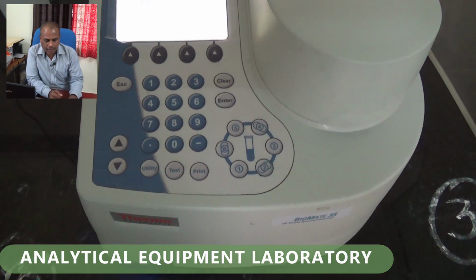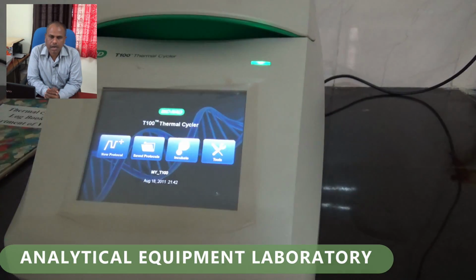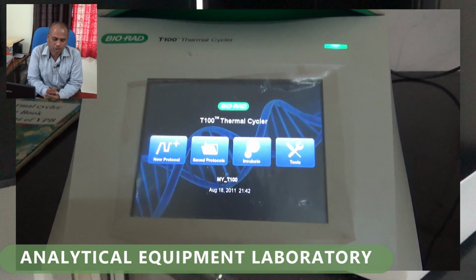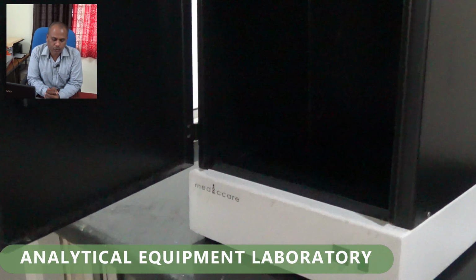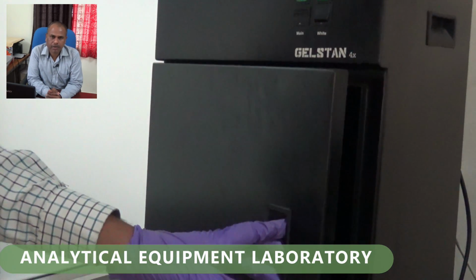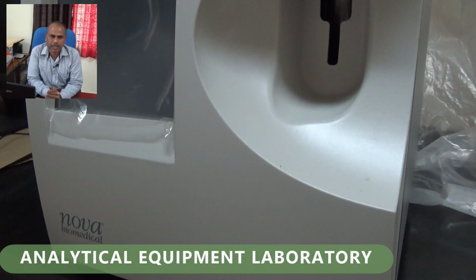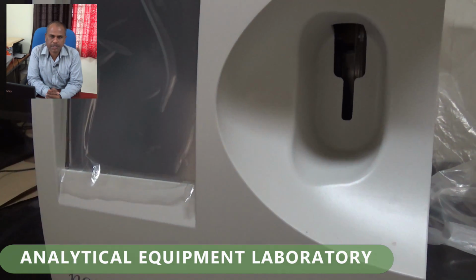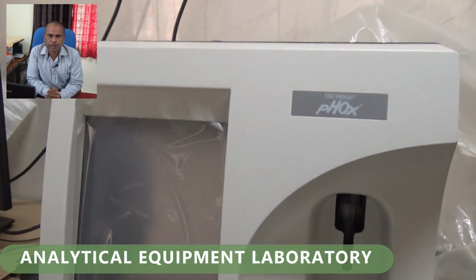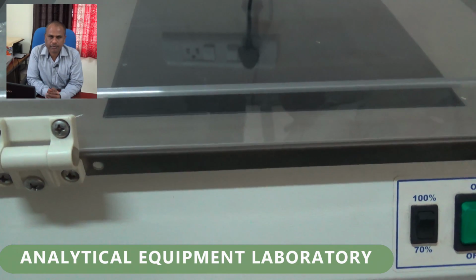The facilities are biosafety cabinet, thermocycler, agarose gel electrophoresis, gel documentation system, UV transilluminator, UV spectrophotometer, blood gas analyzer, shaker incubator, flame photometer, and -20 degree as well as 4 degree refrigerators for cold storage purposes. So these are the various facilities, in brief, about the veterinary physiology and biochemistry department of Veterinary College Shivamogga. Thank you.